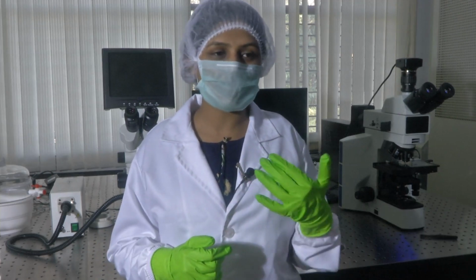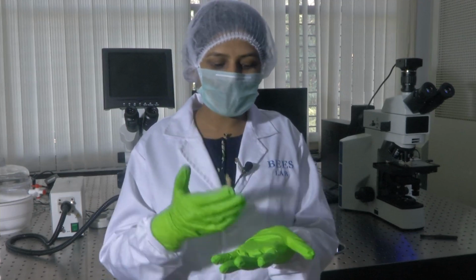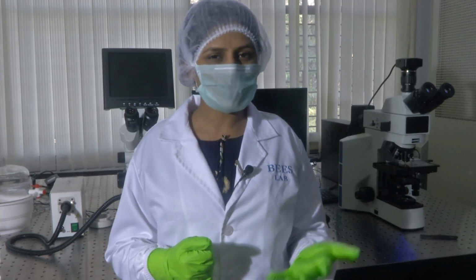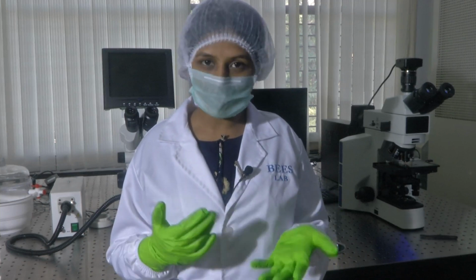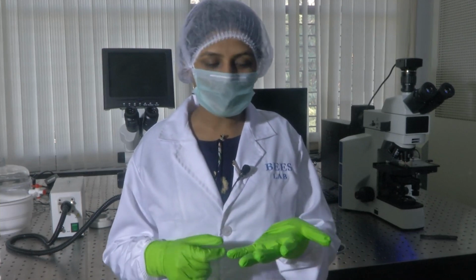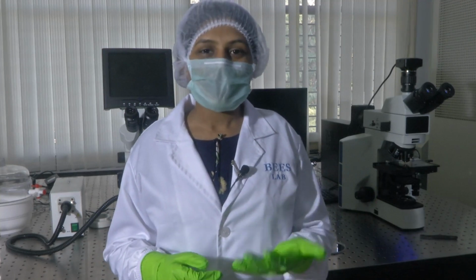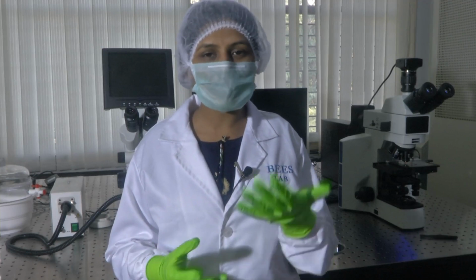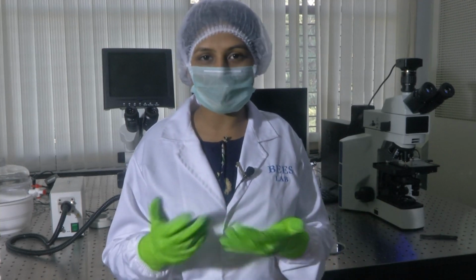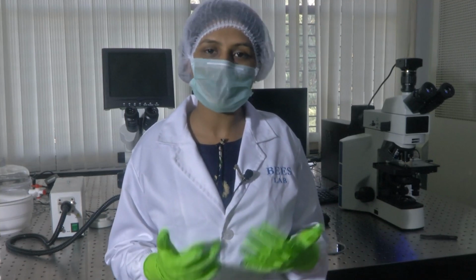So silicon wafers or devices like this are opaque and do not allow light to flow through them. When we are dealing with such a device, what is the choice of microscope? What we use in the lab here to characterize the device functionality or study the features formed on our minute sensors is the metallurgical microscope. The metallurgical microscope is mainly designed to study features of structures like wafers or any other metal coatings. So in that case, an optimal choice could be a metallurgical microscope.